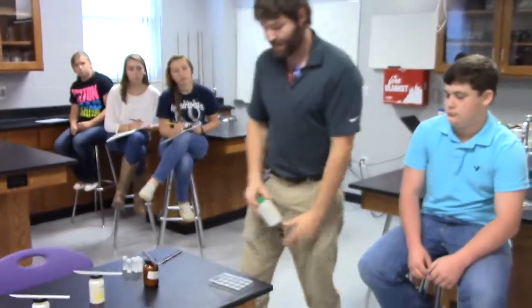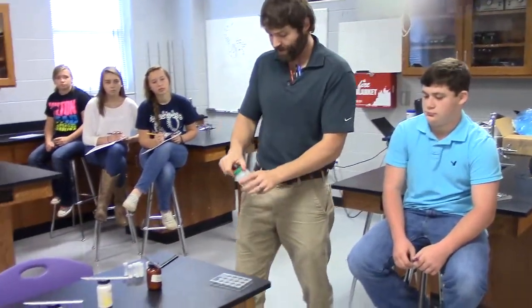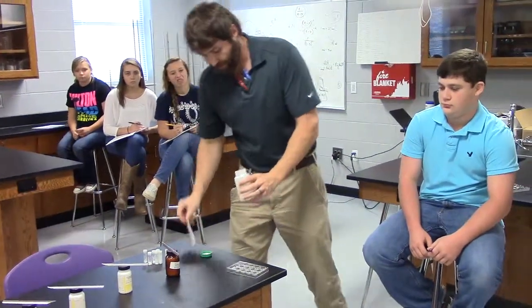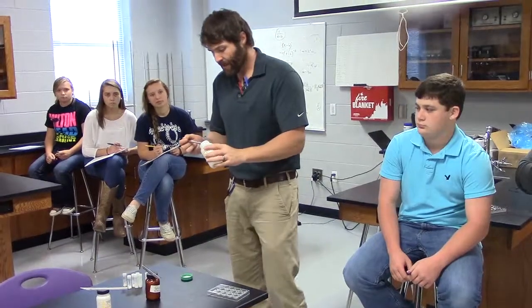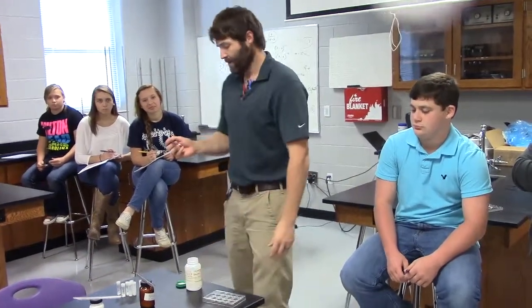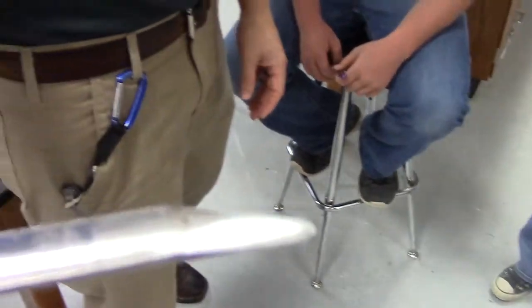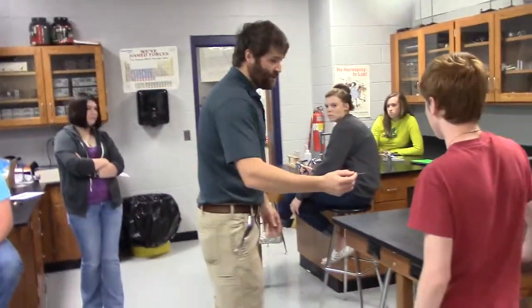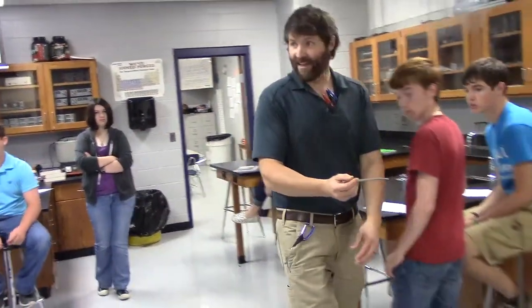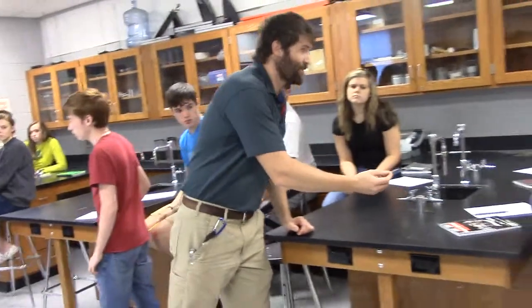So here's what we're going to do. I've got this. It should be clean and dry before we start. I'm going to take the lid off. And then I'm going to come over and I'm going to get just a little bit. So you're going, Mr. Scully, how much is a little bit? I'm saying that's a little bit. So I'm going to walk around. This might even be too much. Hey, if you do the lab and you find out you didn't get enough, guess what you can always do? Come back and get some more.